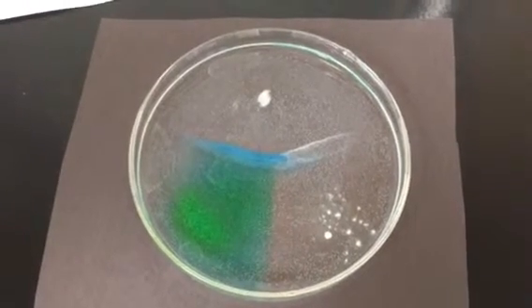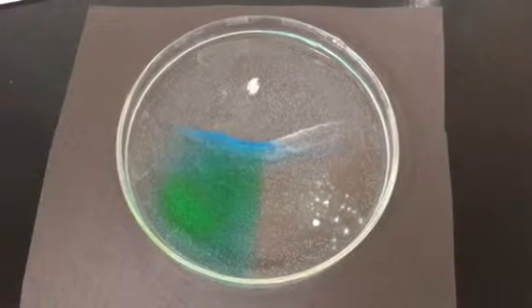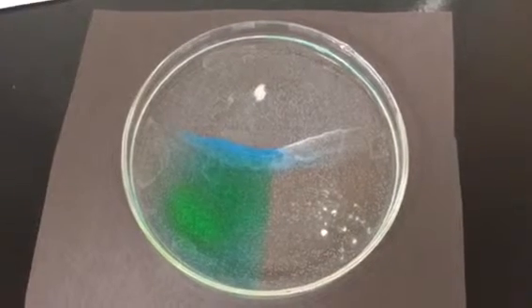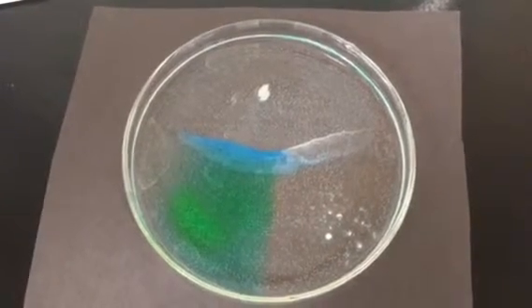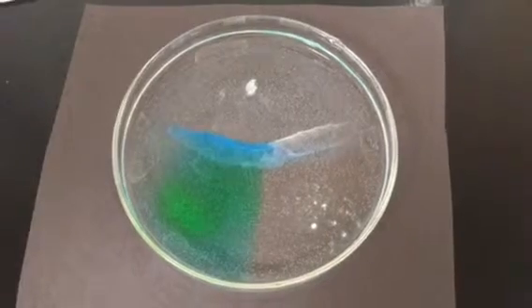So you can see something slowly developing here. Once again, you see this line is made of cloudy material. You have to think what that means. Why is it cloudy or powdery looking, and how is that different from the clear parts of the plate where you just have the dissolved soluble salts? That's continuing to develop.